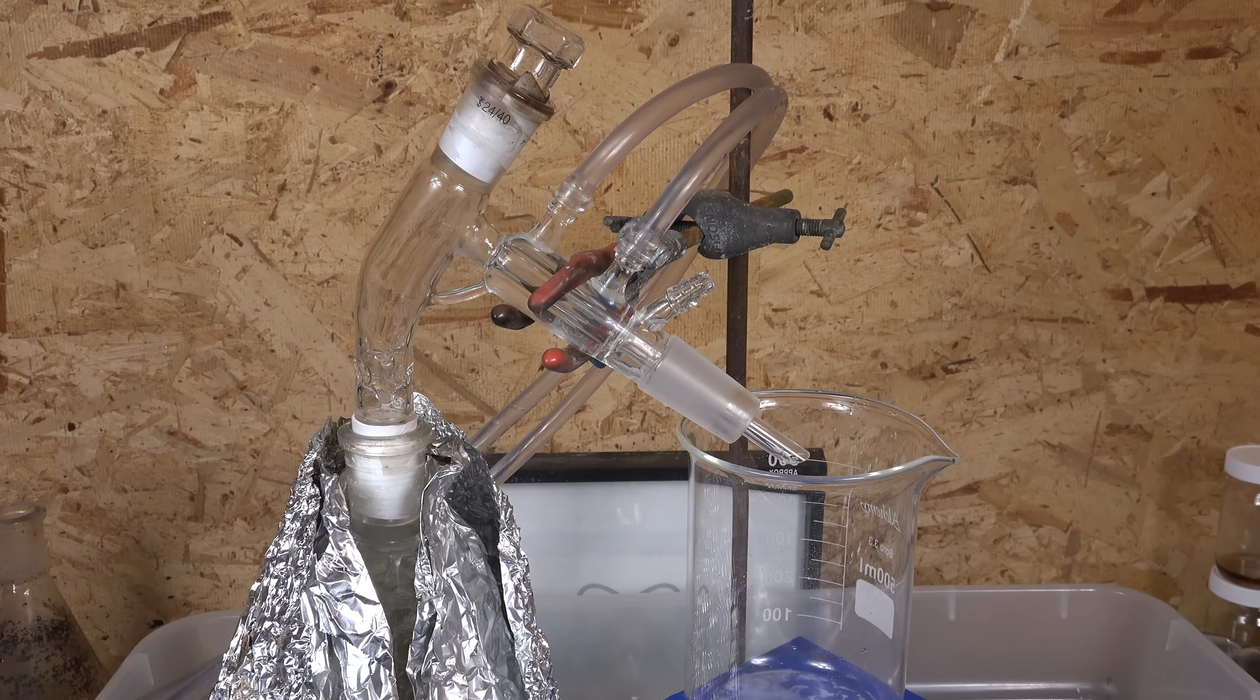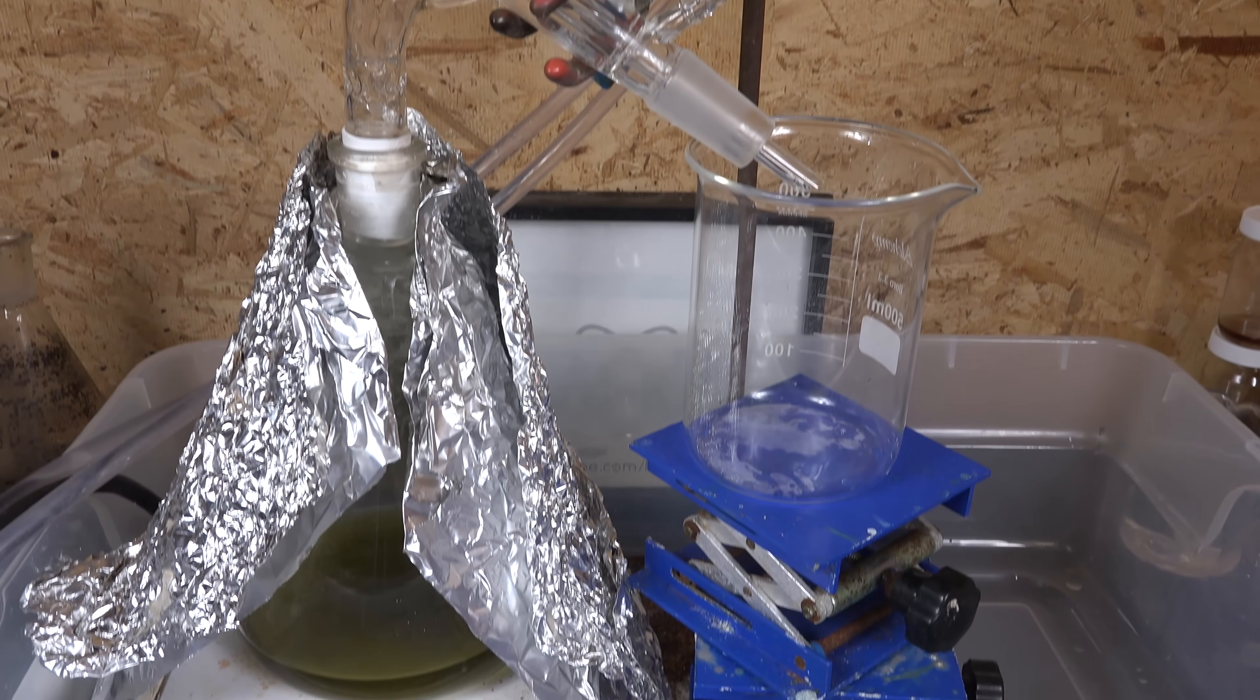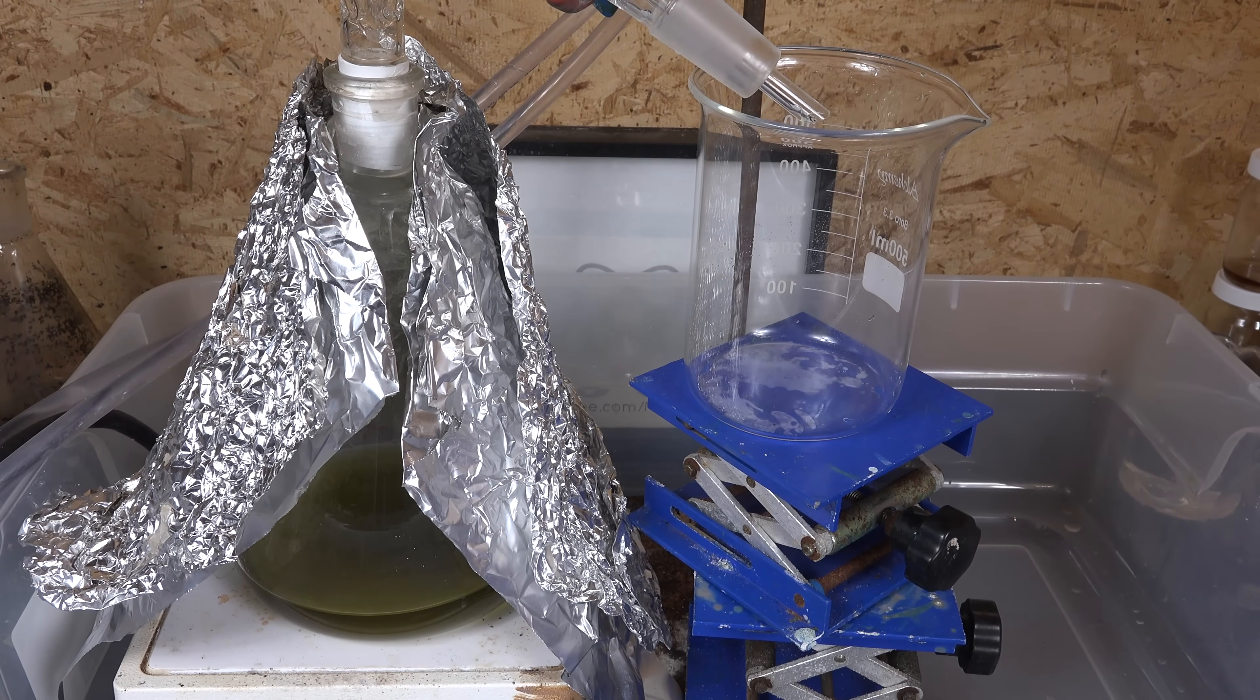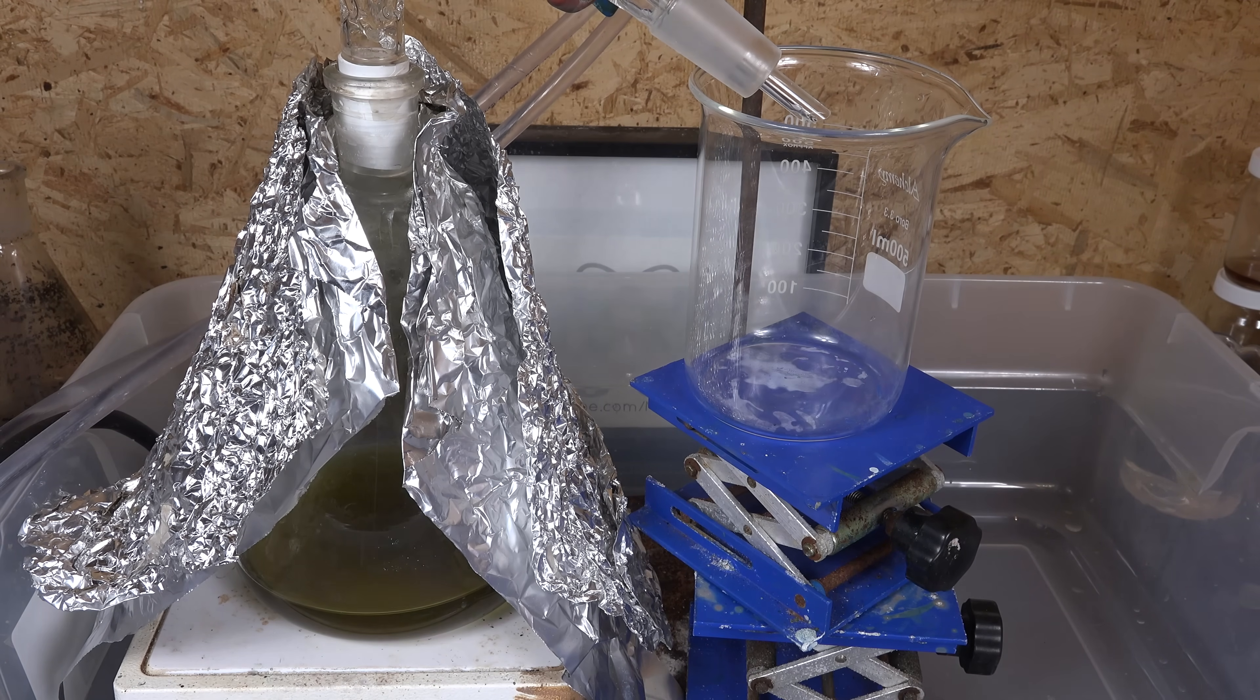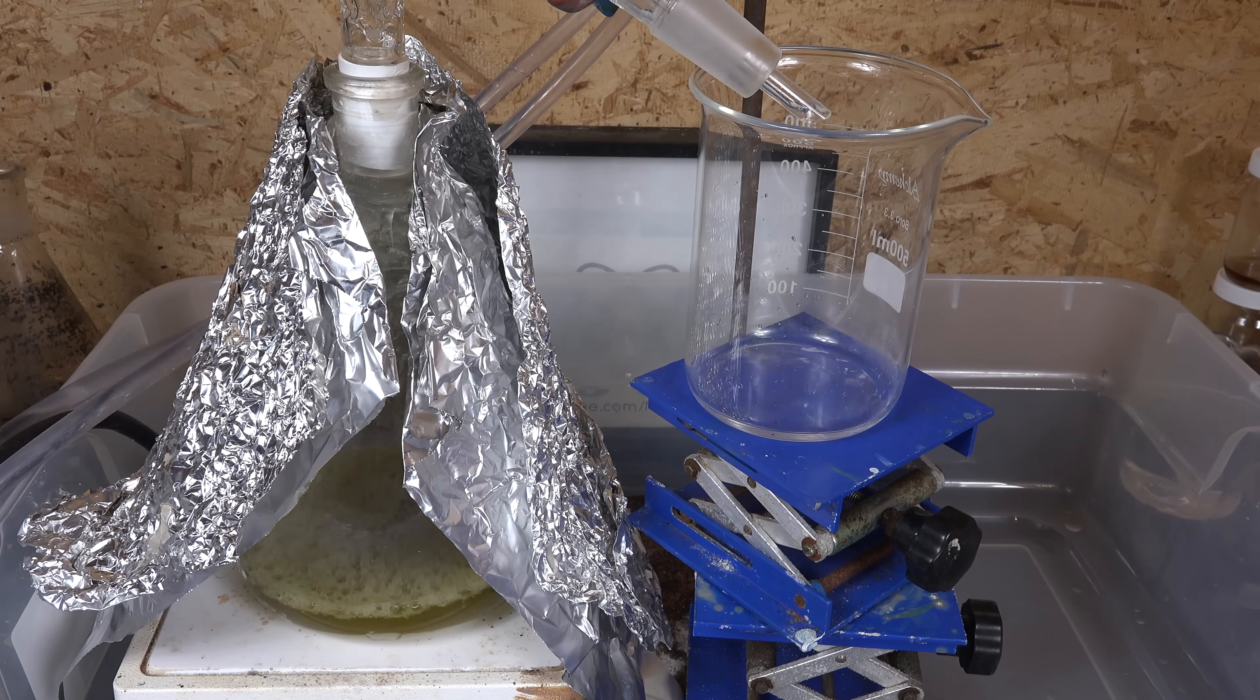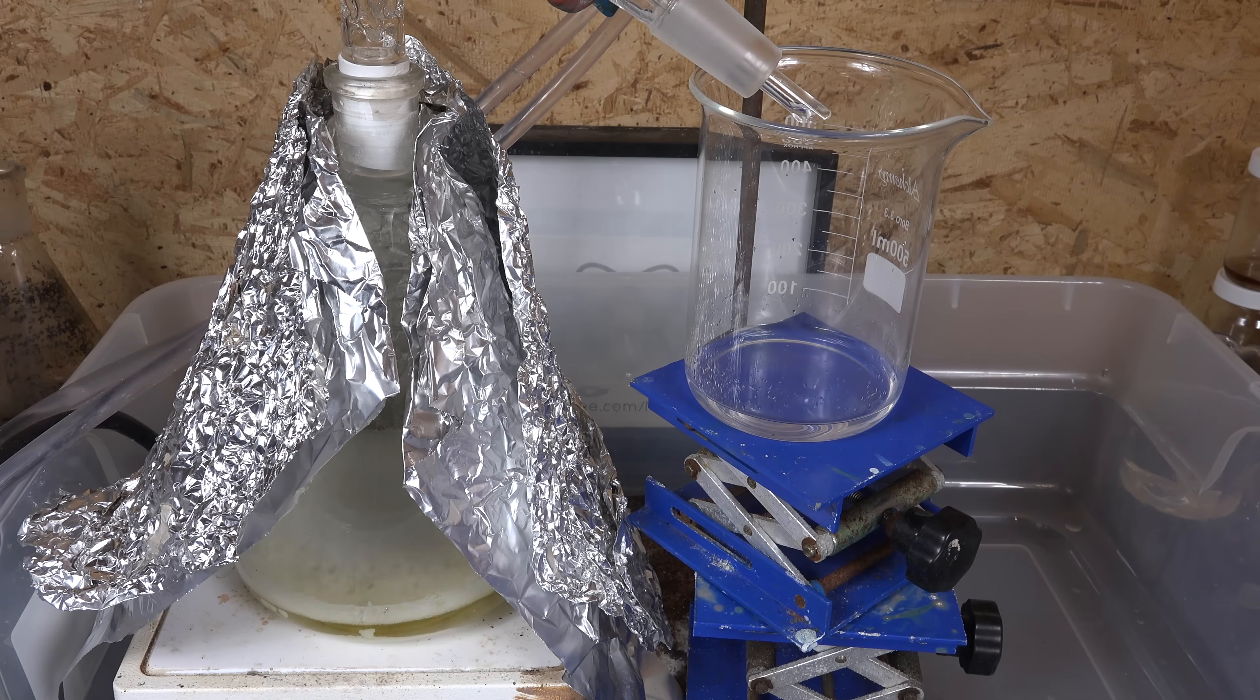So now we set up a sulfuric acid distillation system and distill our sulfuric acid. For further information on how to distill sulfuric acid, refer to my previous video on sulfuric acid purification. Links are in the video description.